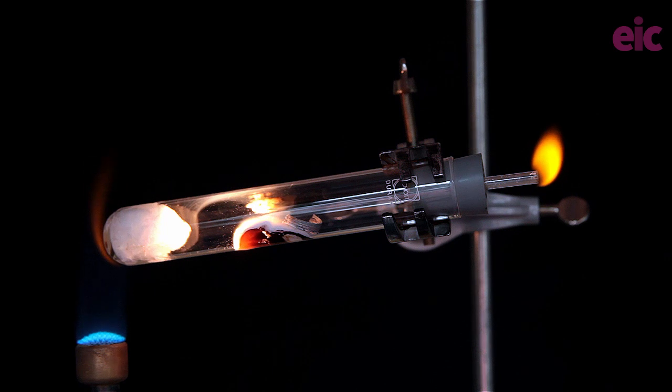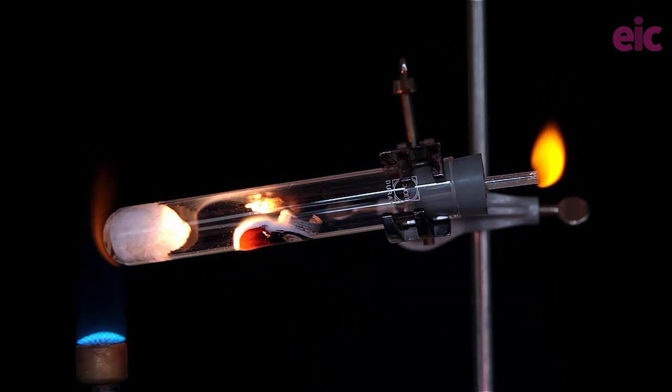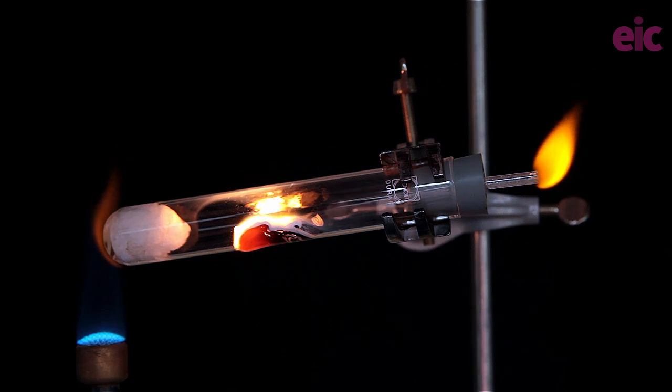You can now light the end of the glass tubing to show the evolved hydrogen linking up the experiment with that of the other metals from earlier.